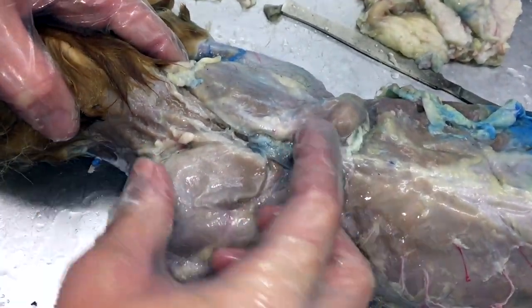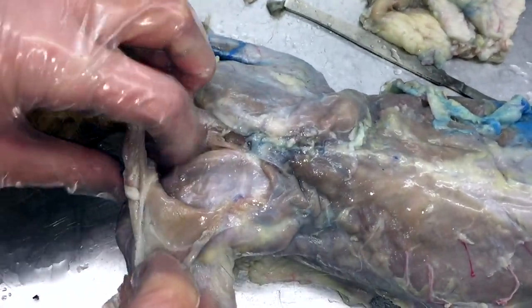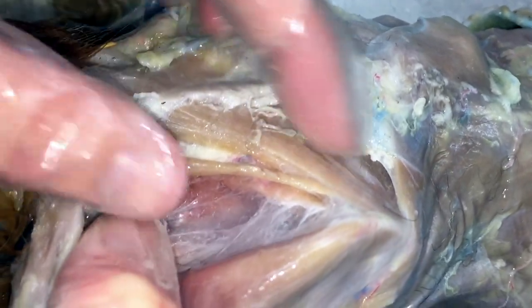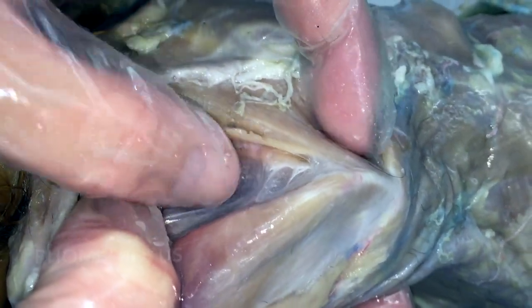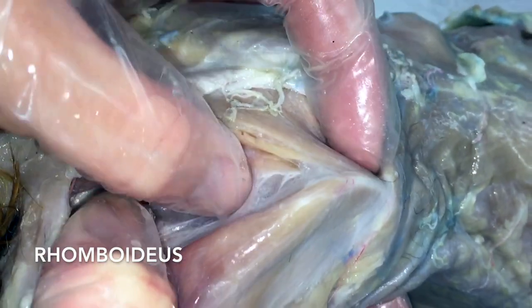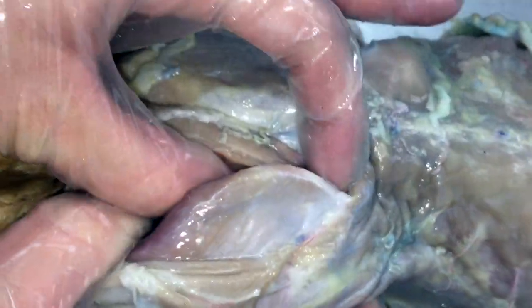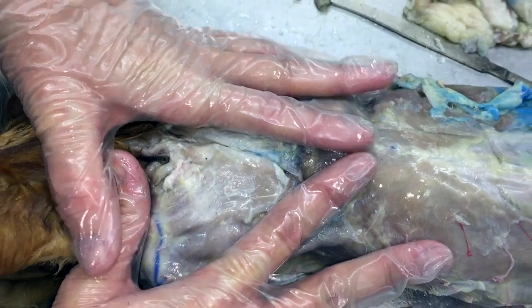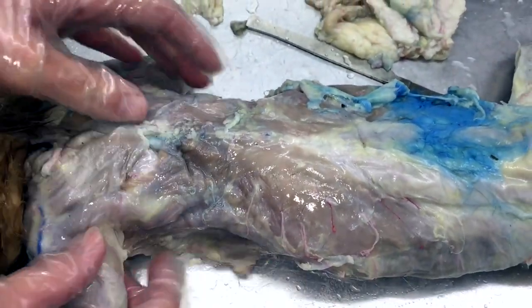You can kind of see the trapezius line. We cut the trapezius and get it out of the way. Deep to that, this is your scapula. You pull it apart from the spine and you can see this chunk of muscle here — this is going to be your rhomboids. You don't need to know major and minor in kitty, just know rhomboids. So this triangle-shaped muscle is your trapezius muscle, and the lower back is going to be the latissimus dorsi muscle.